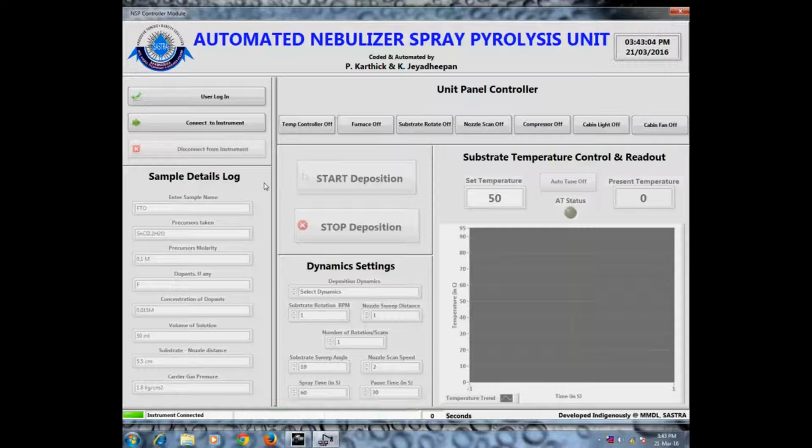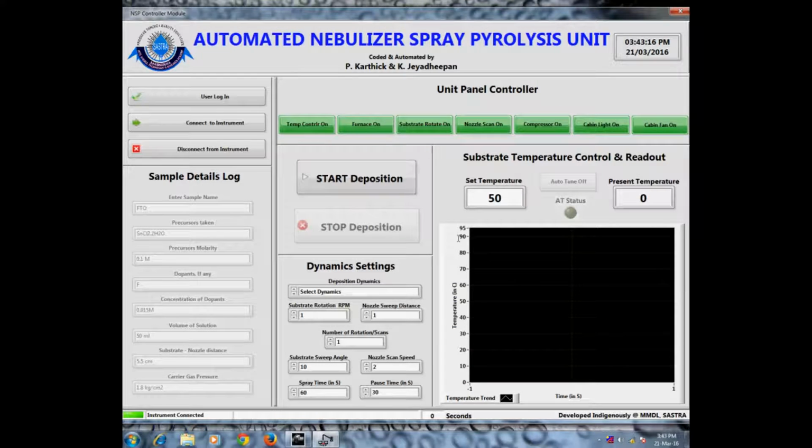As seen already, the control should be switched on in the software too to really energize the operation in the unit. The substrate temperature can be set directly from the software by simply entering the desired temperature in the set temperature control.